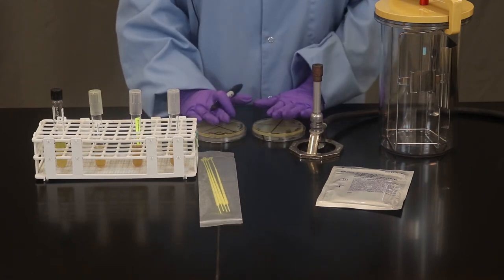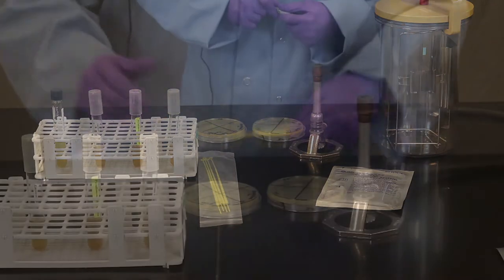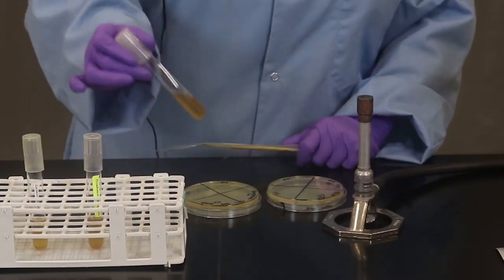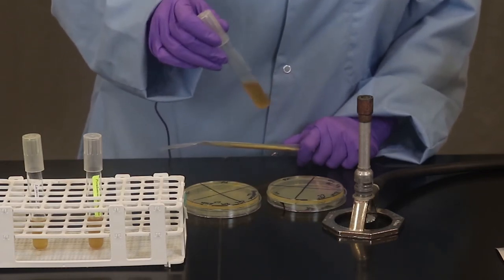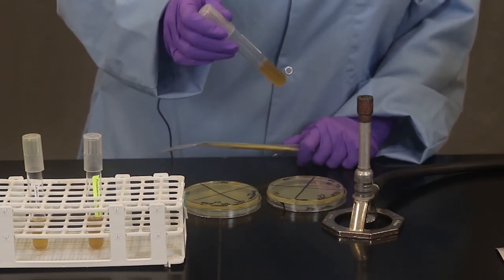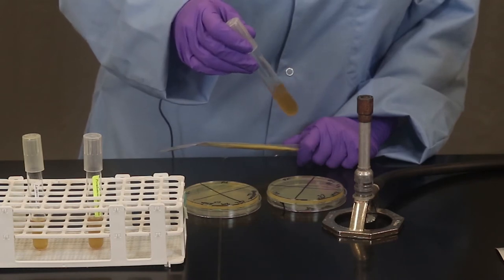Once your two plates are labeled you're ready to get started. So starting with the first bacterium here Serratia liquefaciens. Remember that we would have to appropriately vortex these. I'm not showing you that portion here but I am going to gently mix by swirling.